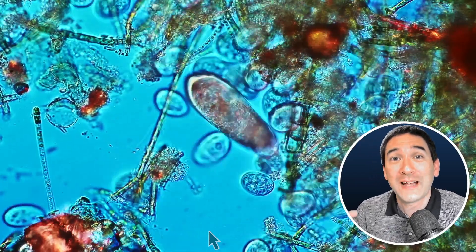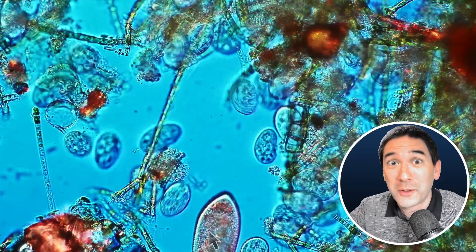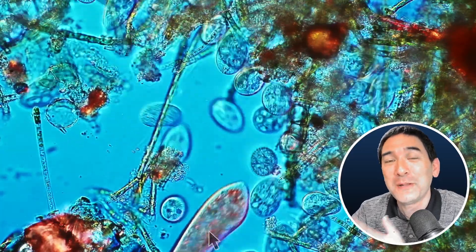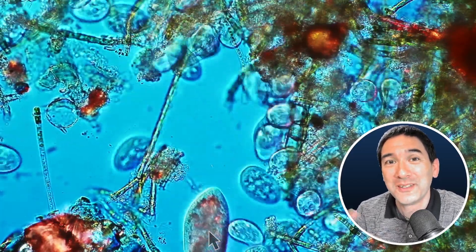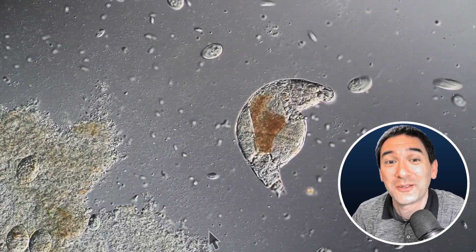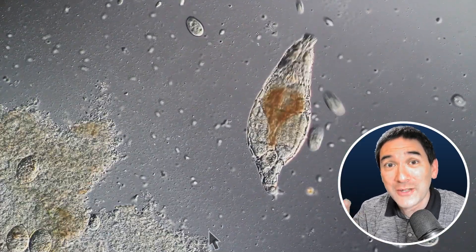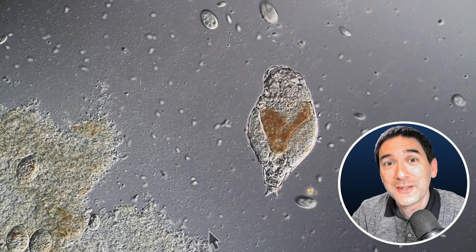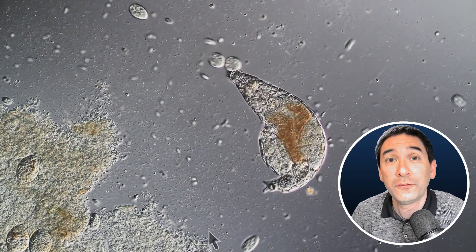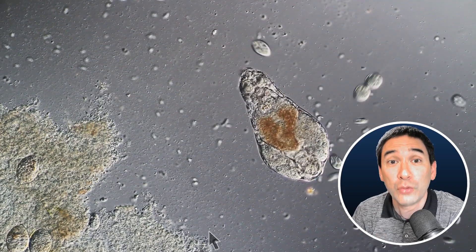If you were to put the glass of water into water — into an aquarium, for example — then you would not be able to see the glass of water anymore, because the refractive indices are the same. And this explanation actually explains also why we're not able to see the individual cells of multicellular animals like those rotifers.